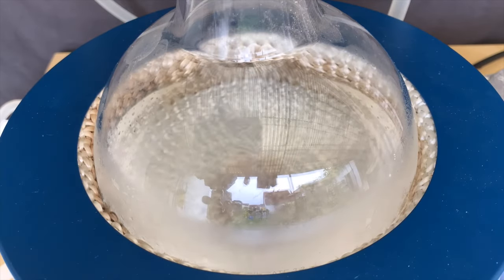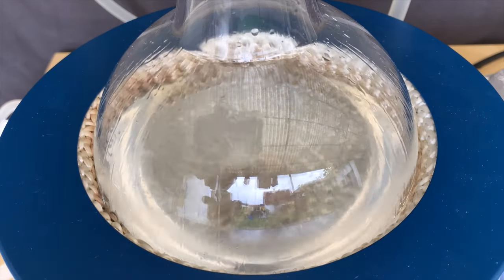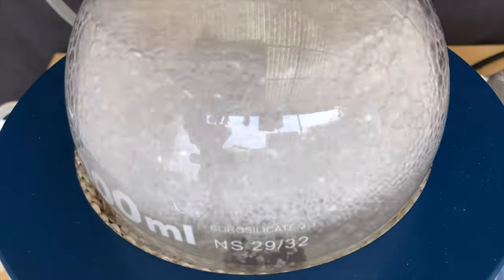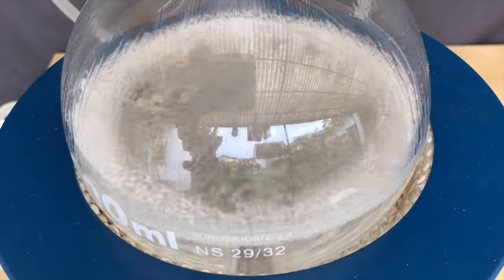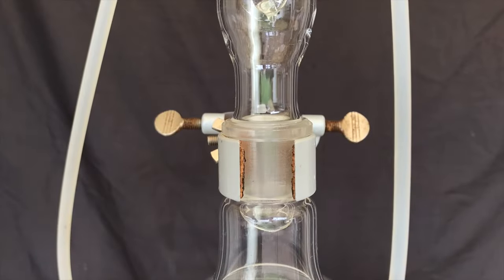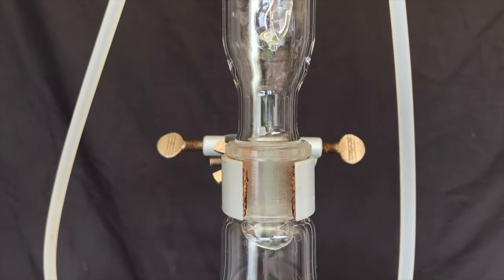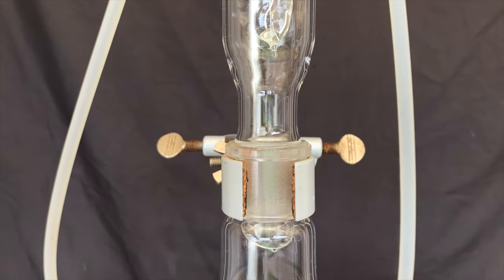A reflux was set up and under stirring the mixture was refluxed for half an hour. The bubbling nearly got out of control because of what I assume was hydrogen evolution. We got it under control by raising the flask. The rest of the reflux was very calm and no further incidents happened.